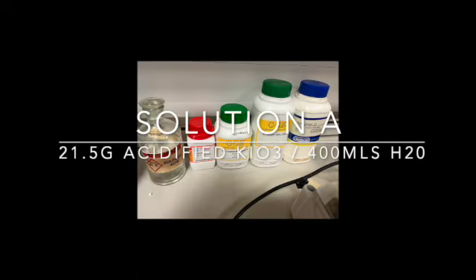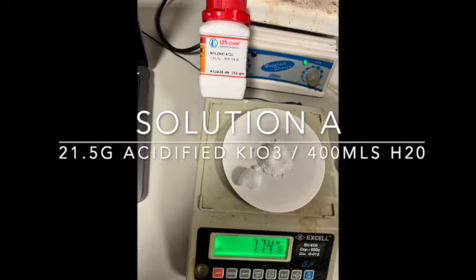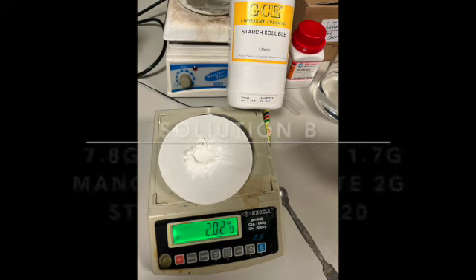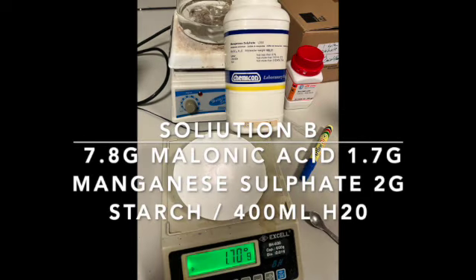Welcome to the Briggs-Rauscher reaction, a beautiful reaction. Solution A, you can see the ingredients there, they all go into solution quite merrily.